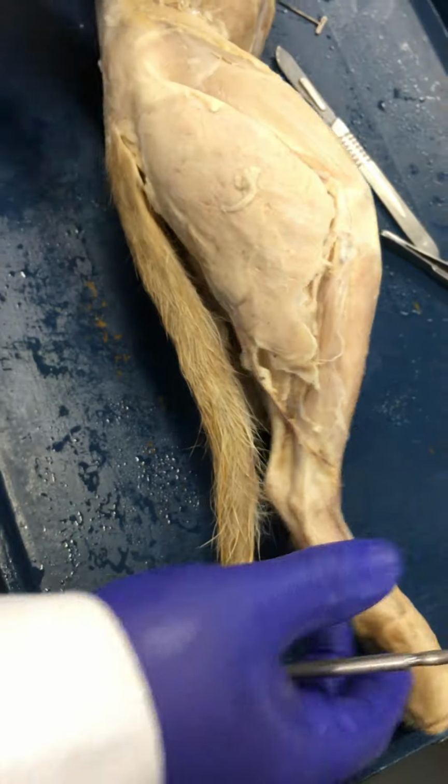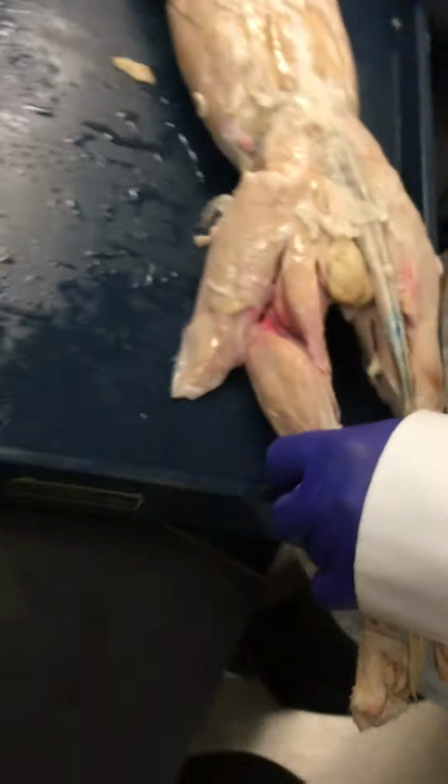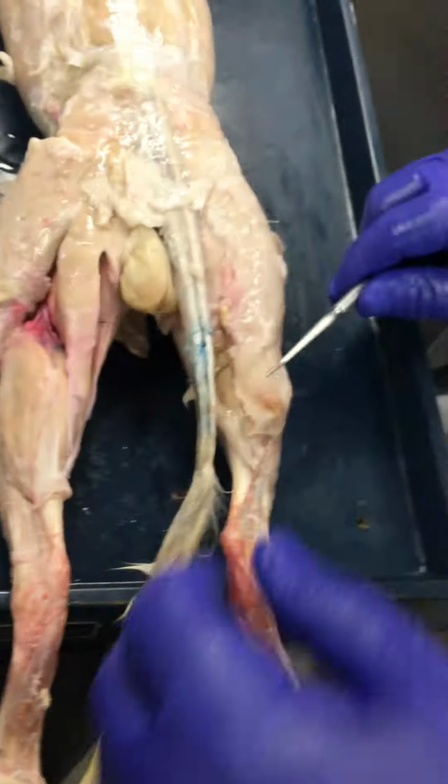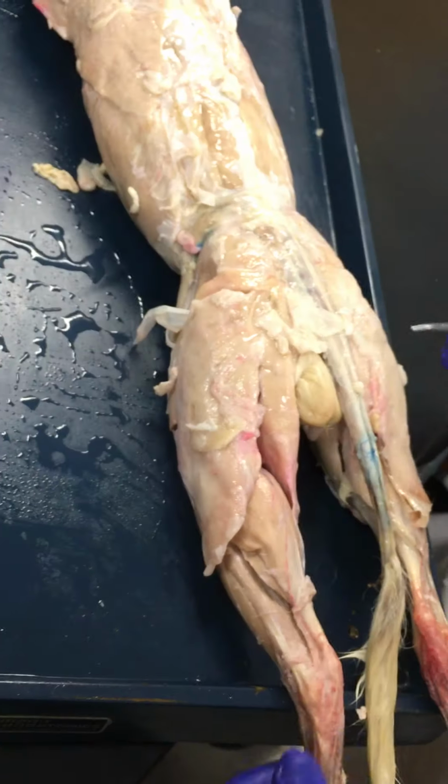Let's check out that cat over there. We can just walk over there. You can pause that video. Just walk over. Oh, you can push it. We gotta go down there. Yeah, you guys go. Crural? Yeah. So let me see where you guys did this. Alright, so we're looking pretty good here.